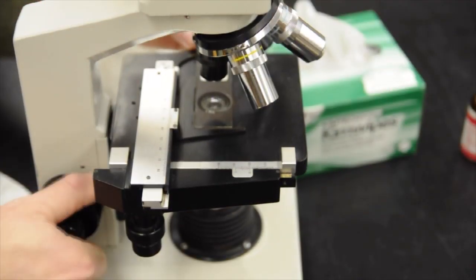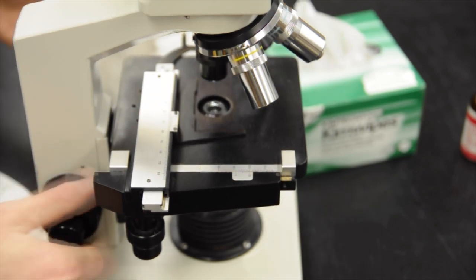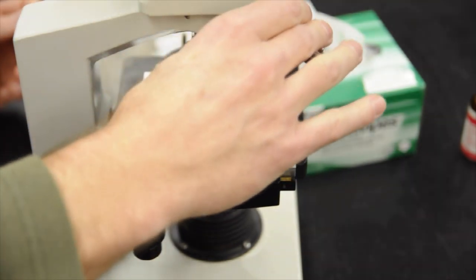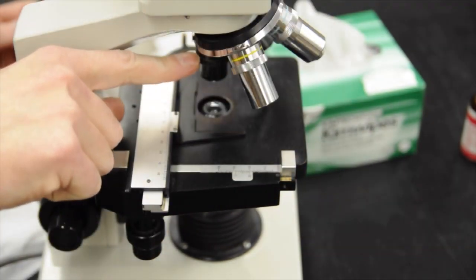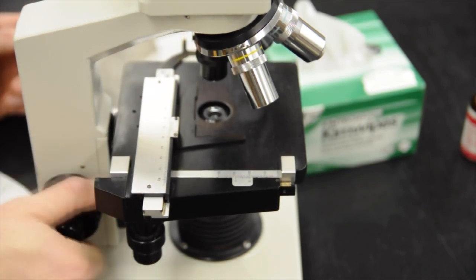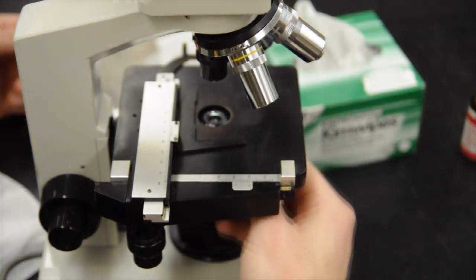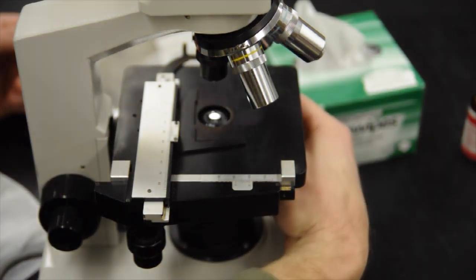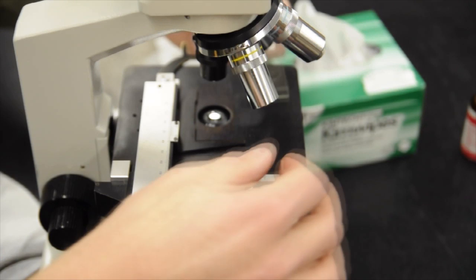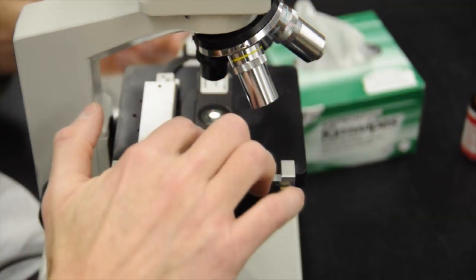Now I want to show you it again from a different angle. First, lower the stage all the way down. It's always good practice. Make sure it's on the lowest objective, which is our 4x lens. Use the coarse knob adjustment to move it down. I open up the iris, or make sure you're familiar with the iris again.